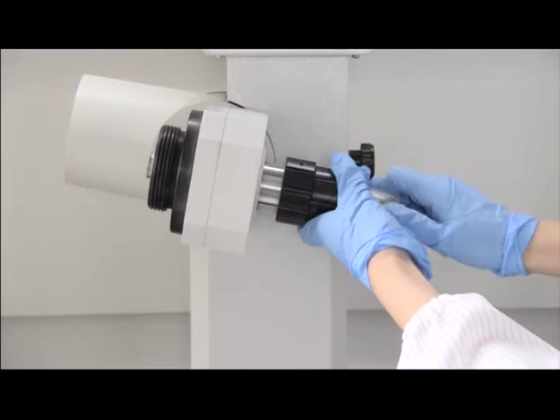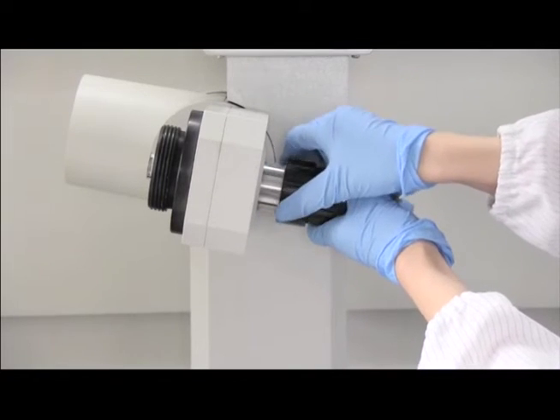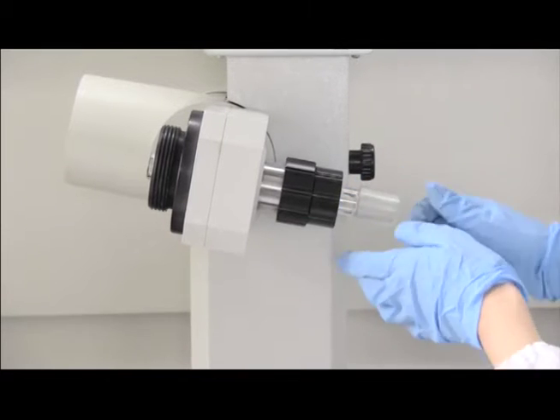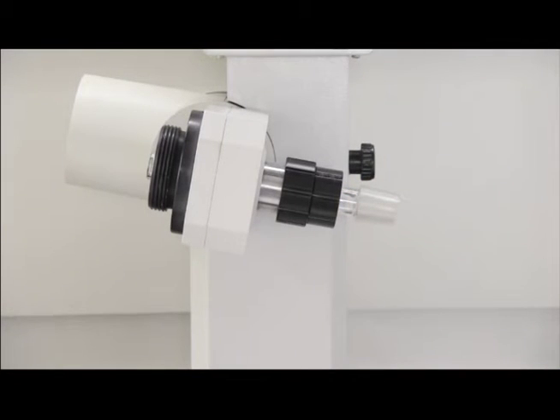After the vapor duct is installed, rotate the locking nut clockwise to lock in the vapor duct. Test the fitting by trying to pull the vapor duct out.